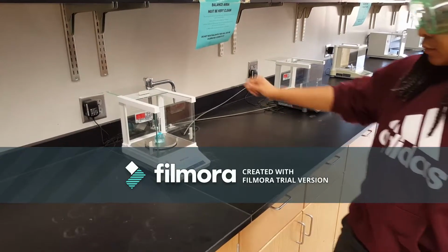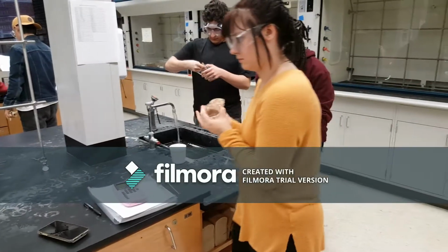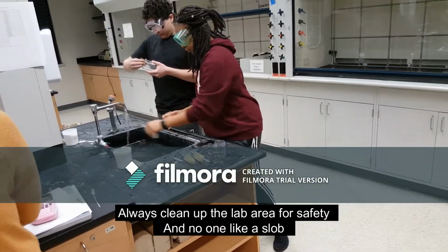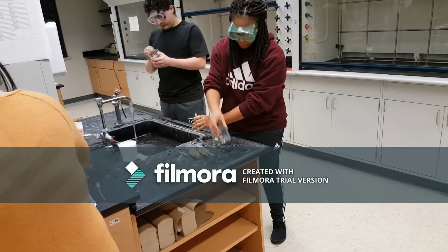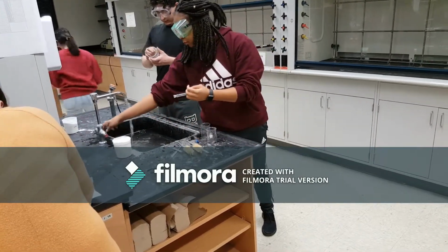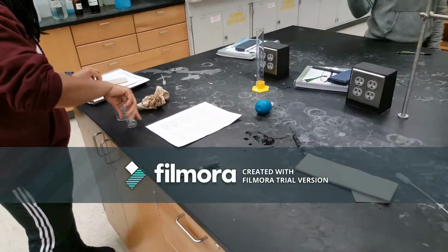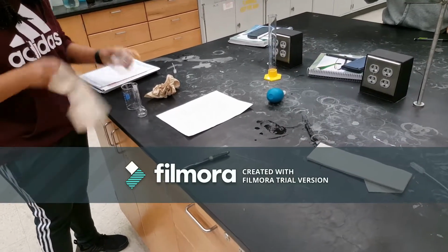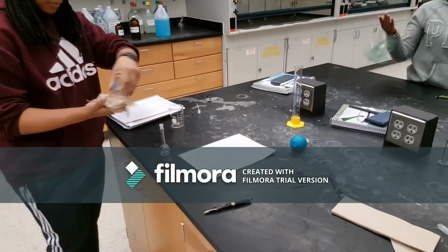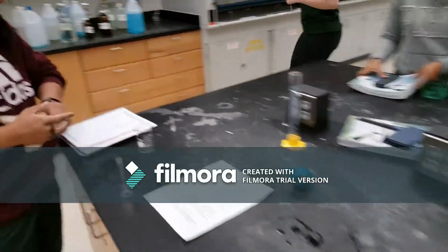All right, you're good. You can go ahead and pull it off. 51.303 and then zero it out again. And then wipe the counter too. Actually.